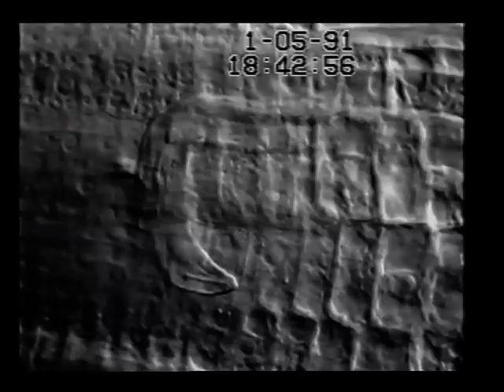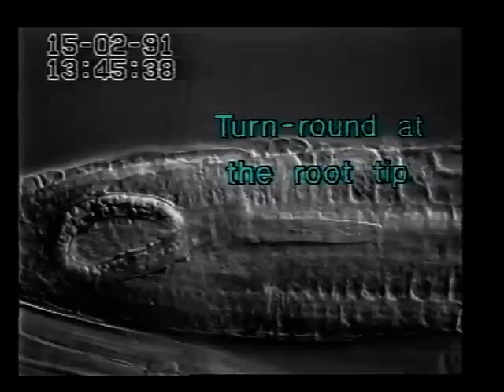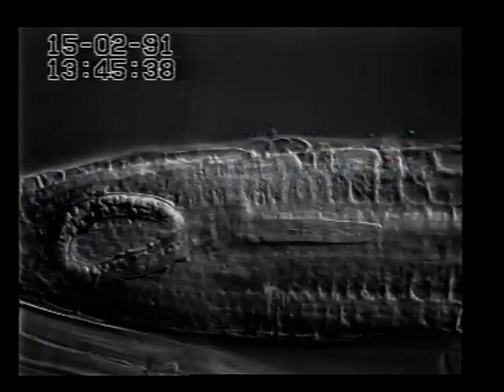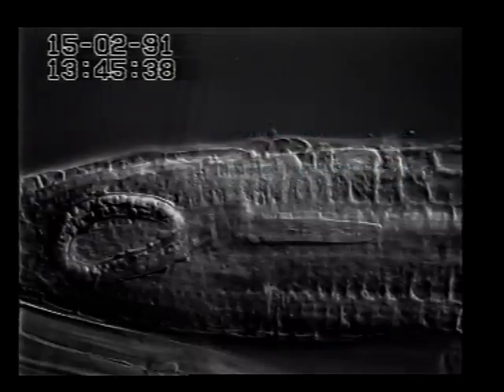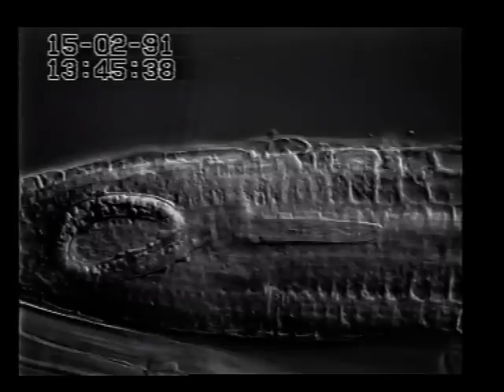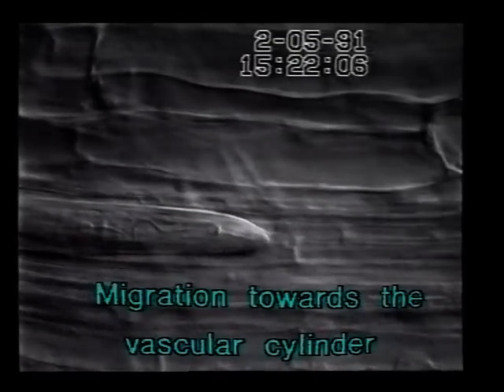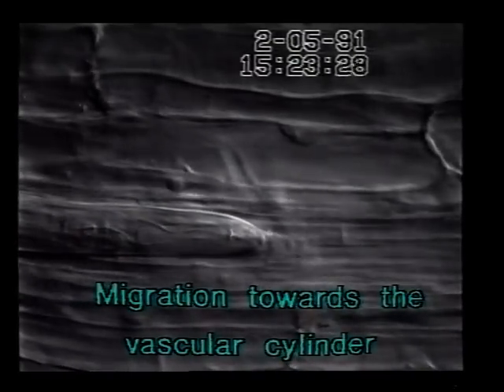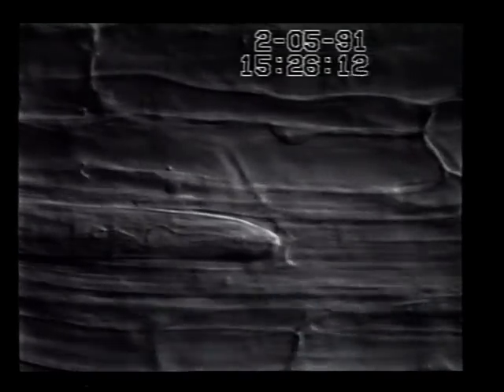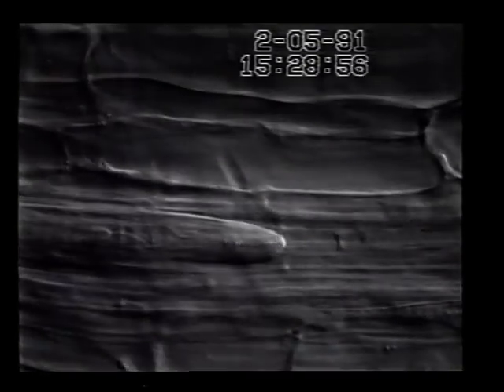When the juveniles have entered the meristem, they turn round and orient themselves towards the root base in the center of the root. At the root tip, the vascular cylinder is not yet differentiated, but it gradually approaches the backward migrating nematode so that it is finally entered by the juvenile. With this strategy, the nematodes are able to avoid the obstacle imposed by the endodermis.